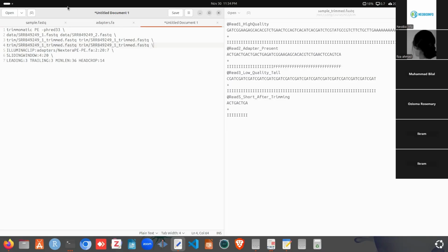For read 1, we will have one file that is trim paired.fastq and trim unpaired.fastq, and for read 2, we will have the same: the first one will be paired and the second one unpaired. You can see here, this is for the R1 read. For R1, we have paired and unpaired, and for this one we will have paired and unpaired. So you can ask the question: what does the paired file contain and what does the unpaired file contain?